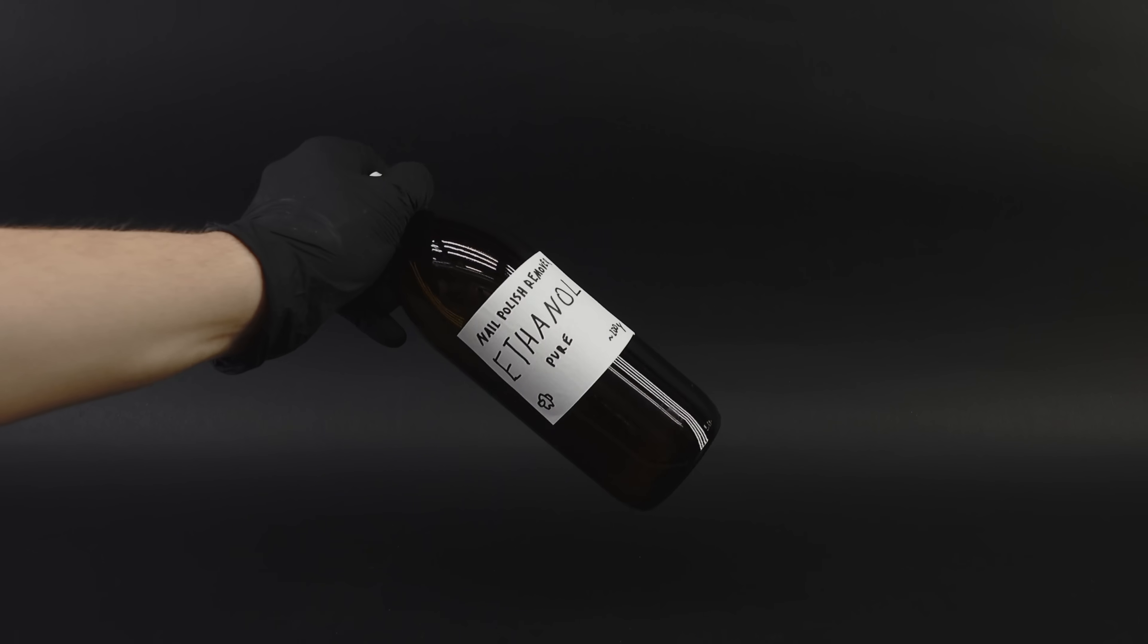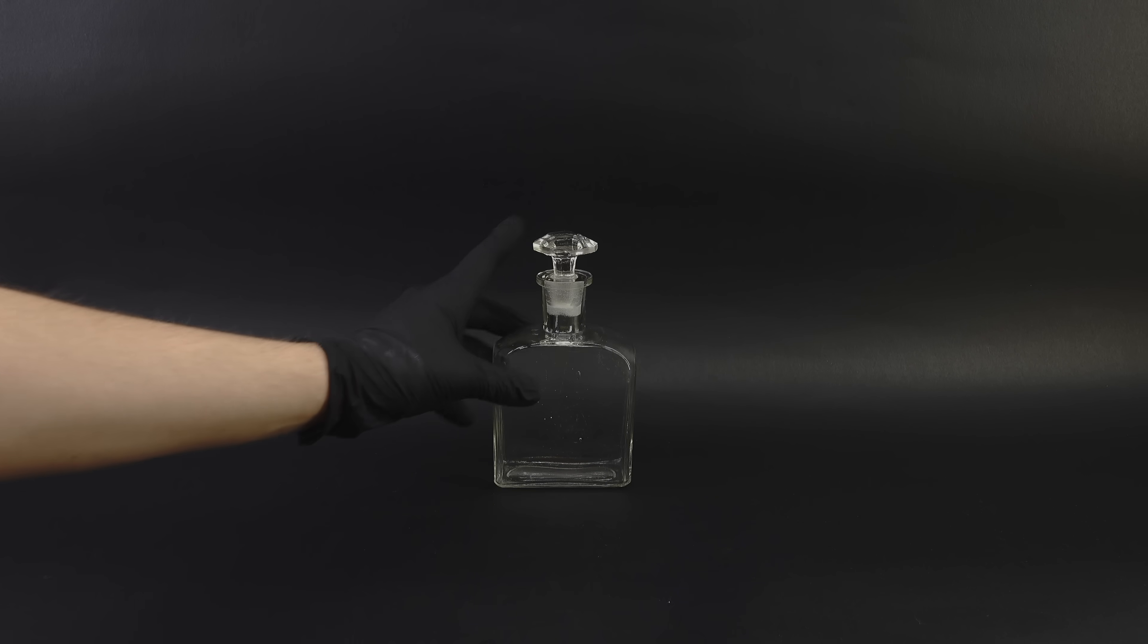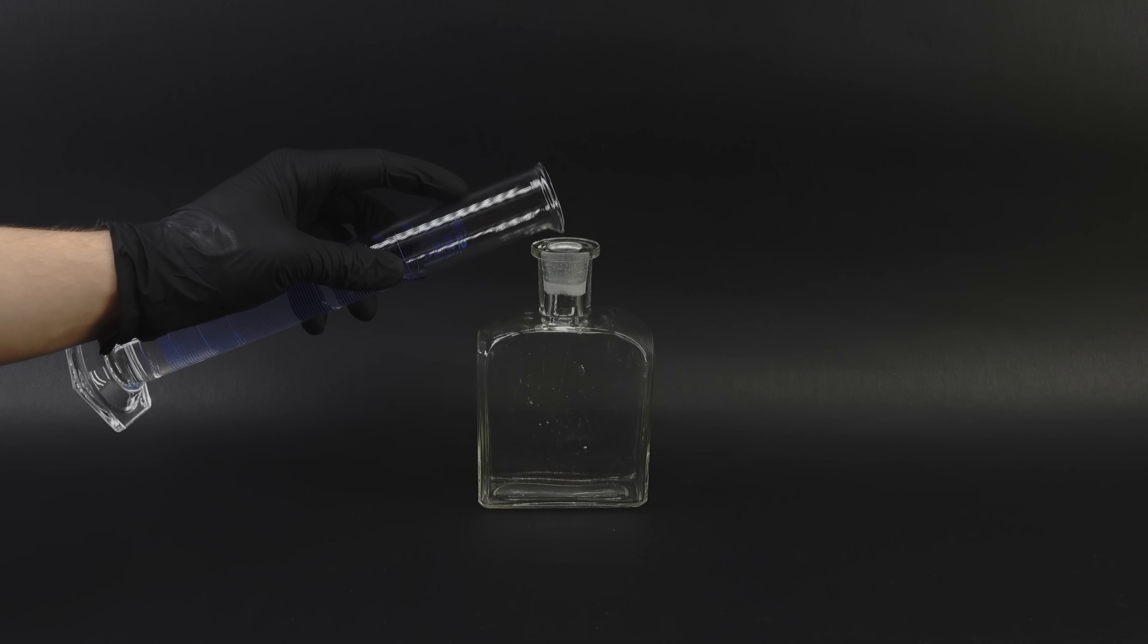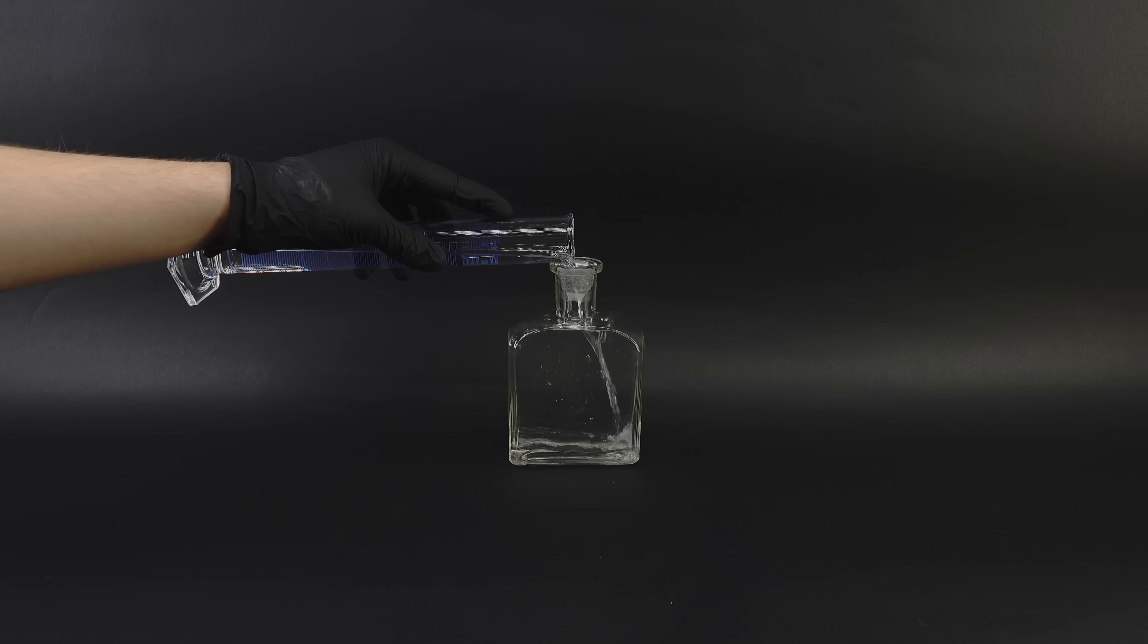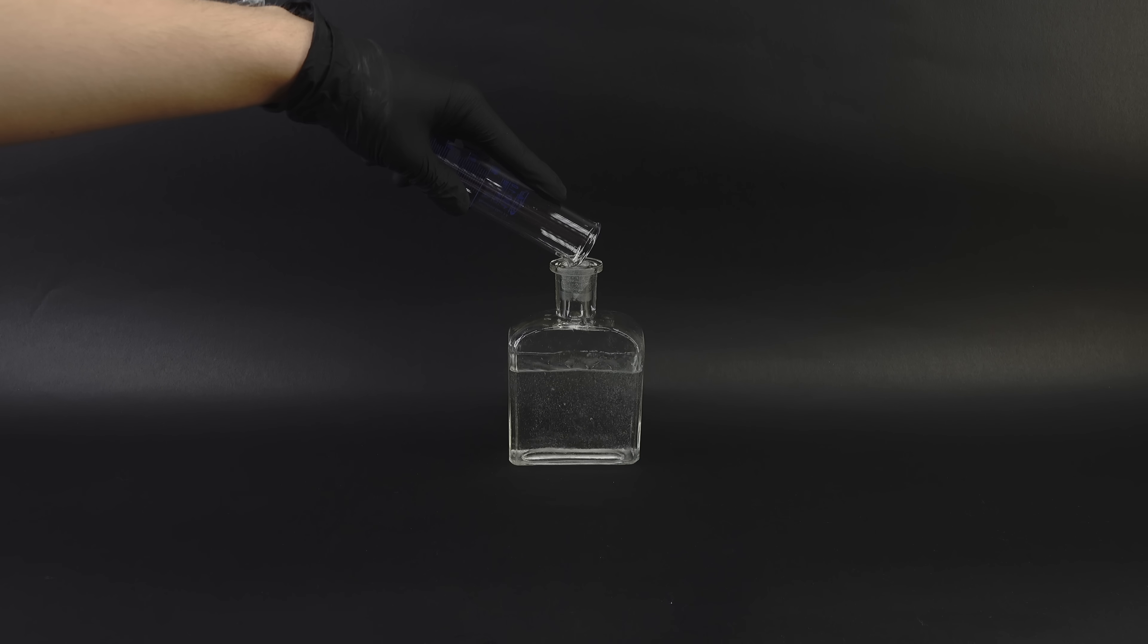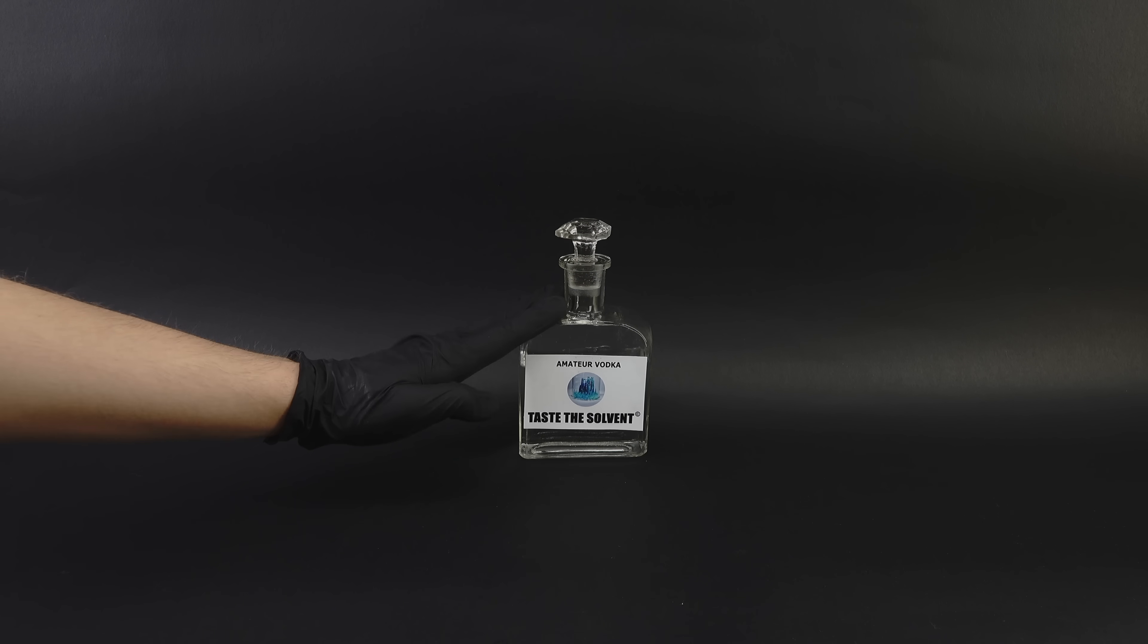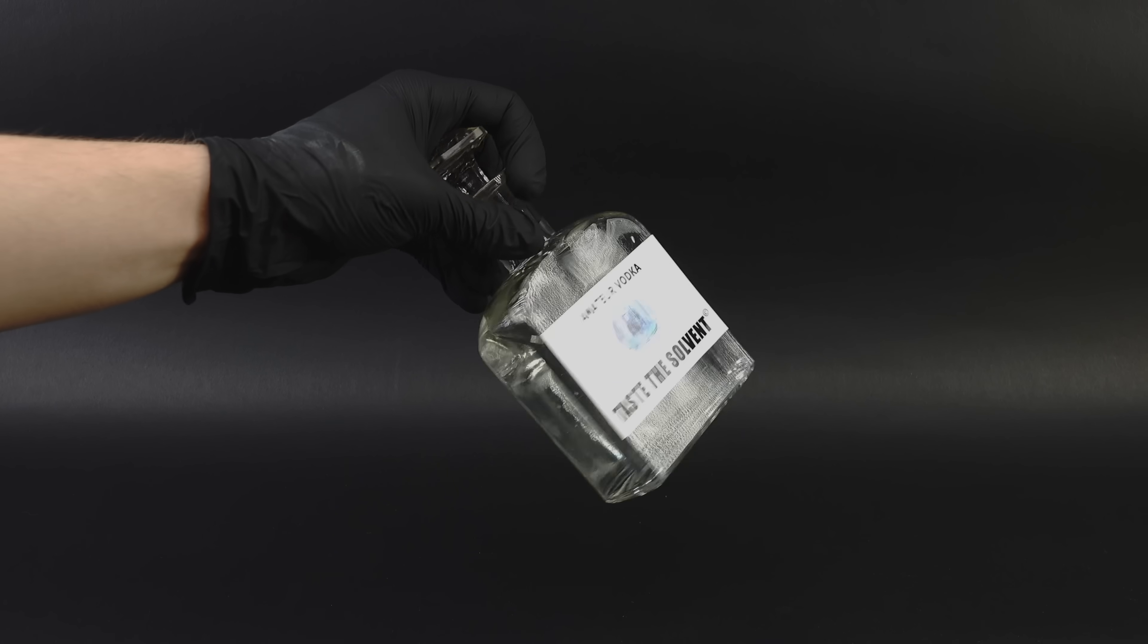Now, this is cool and all, but the real question is, does it make good vodka? To find out, I first got this fancy antique bottle, which I bought only for this project. Making some vodka was actually way easier than I expected, since it's basically just a 40% solution of ethanol in water. I quickly whipped up 200ml of this stuff, and after mixing everything together and slapping on the best branded label the world's ever seen, I felt a sense of fulfillment. Sure, this isn't any fancy vodka, but it is my vodka, and I was just dying to see how a drink that was once nail polish remover would taste.